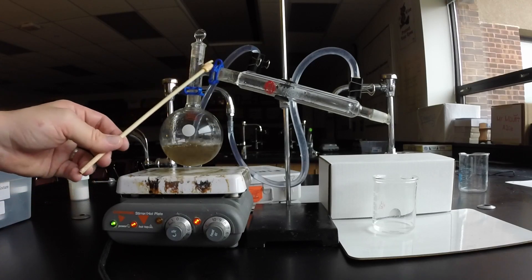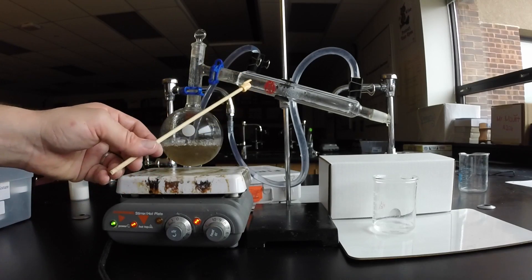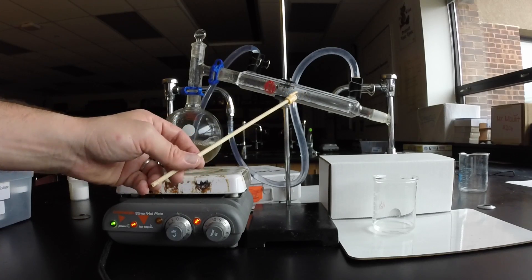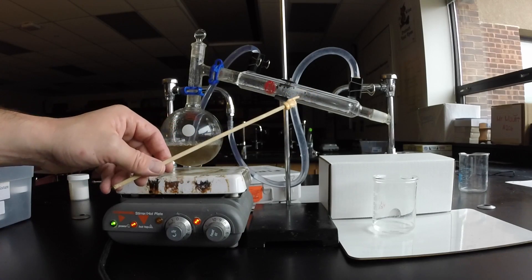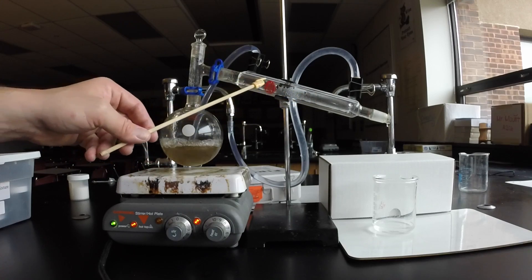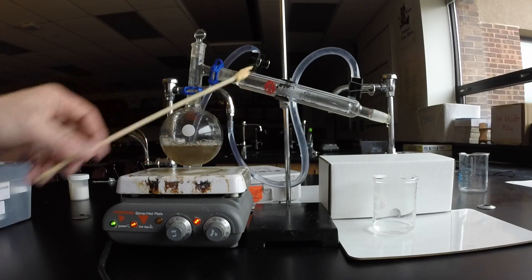So when the water enters the condenser, when it touches the cold glass, it condenses back into a liquid. And you can see that here. If you look carefully, you can see droplets forming on the glass.